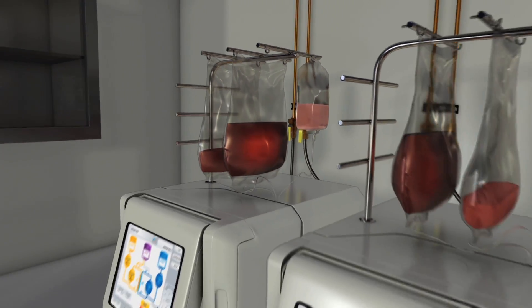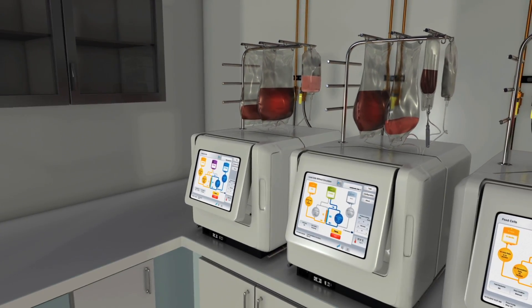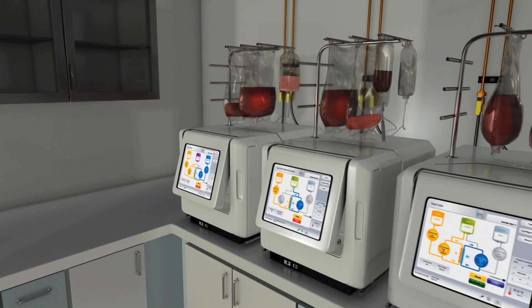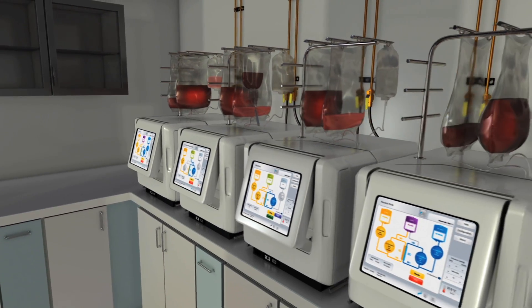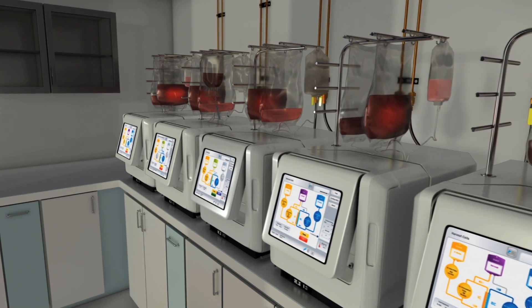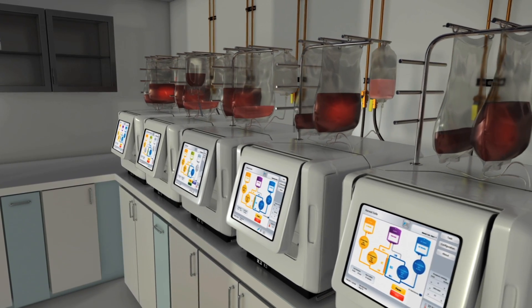The Quantum Cell Expansion System transforms previously open, labour-intensive tasks into a closed, automated, reproducible and scalable process for cell expansion.